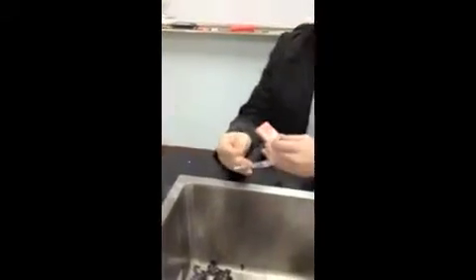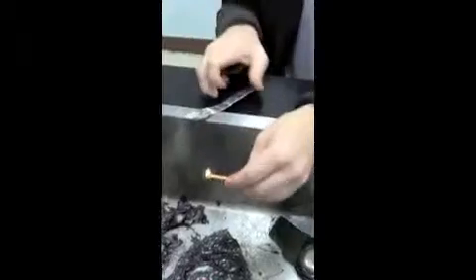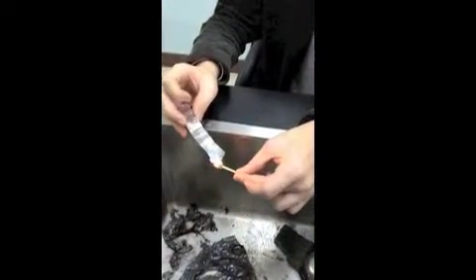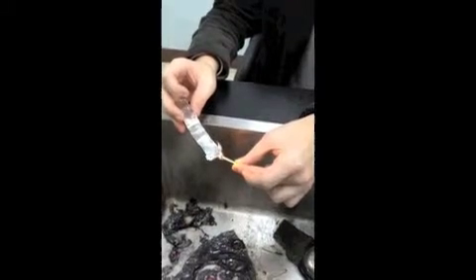What we're trying to do here is burn aluminum with a match. We have the burning match, and Mr. Algar is going to light the aluminum for us. As you can see, the aluminum is not combusting, so we can already tell that it is not very flammable.